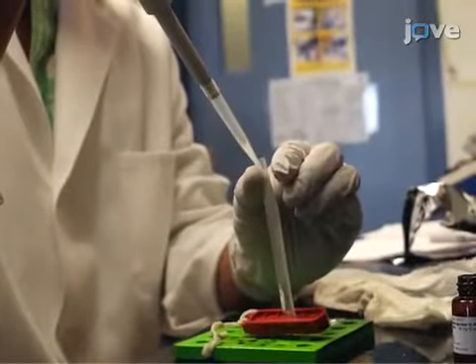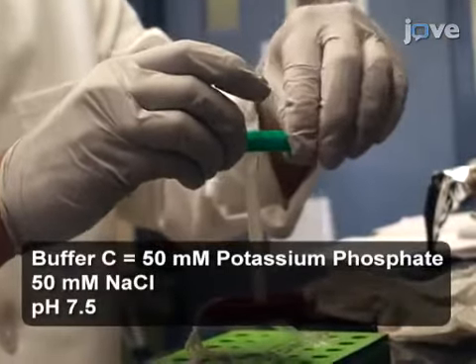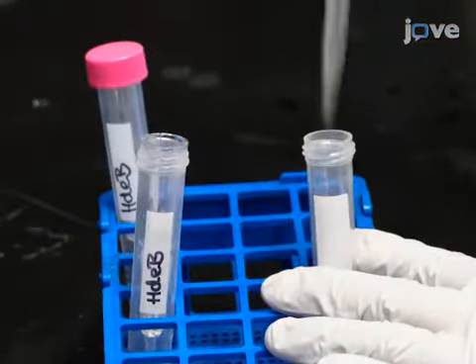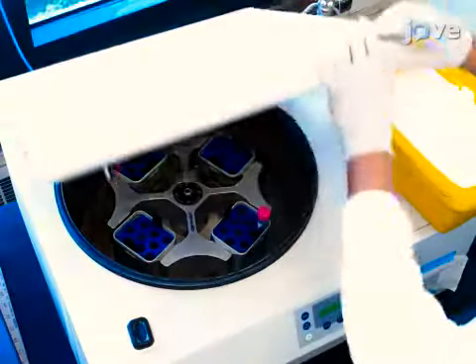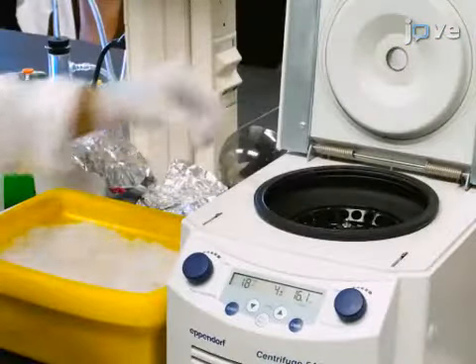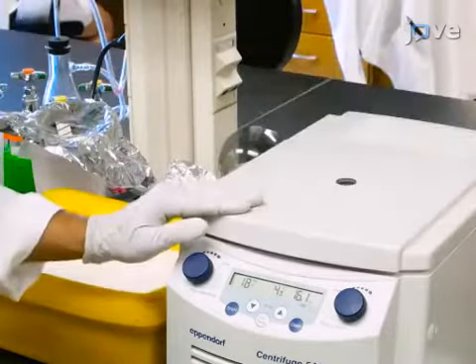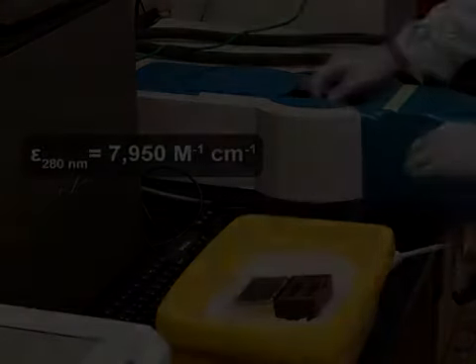Dialyze MDH at four degrees Celsius overnight against four liters of buffer C. Then concentrate the protein to approximately 100 micromolar using centrifugal filter units with a molecular weight cutoff of 30 kilodaltons. To remove aggregates, centrifuge the protein for 20 minutes at 20,000 times g at four degrees Celsius. Determine MDH concentration by absorbance at 280 nanometers.